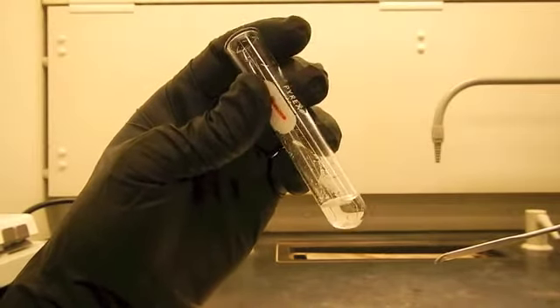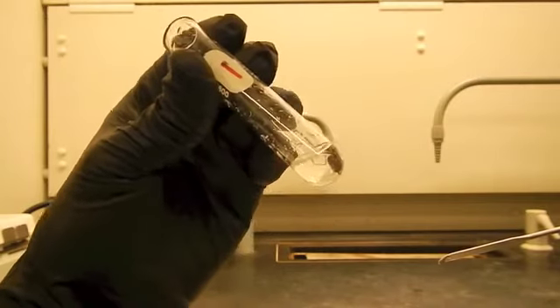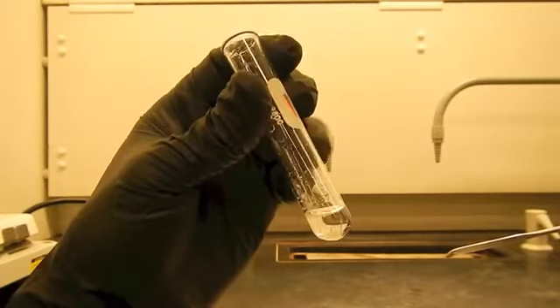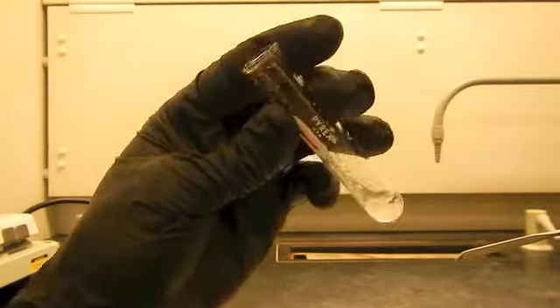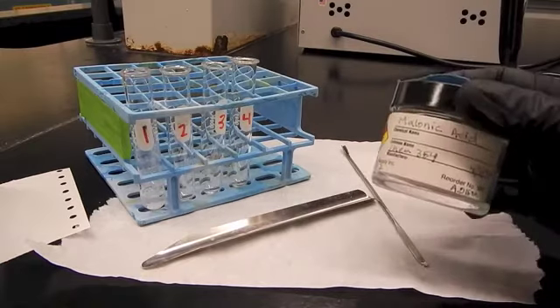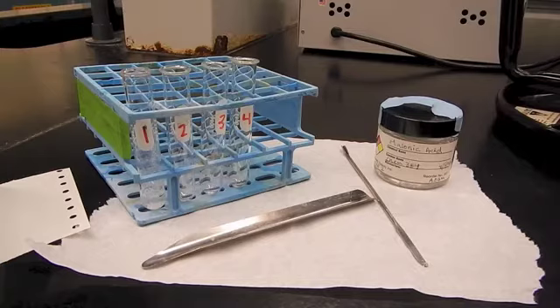Now, this is going to be sort of subjective, so what I would recommend you do is check with the people around you. Ask them what they think. If you disagree, then you can redo the experiment and discuss with one another to find out what the best option might be. So once you finish part A with the benzophenone, then you're going to do the same exact set of experiments with malonic acid. And again, when you're doing these experiments, check with the people around you to make sure that you all agree on the assignments that you come up with for partially soluble, insoluble, totally soluble, things like that.